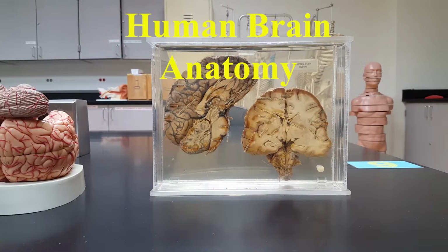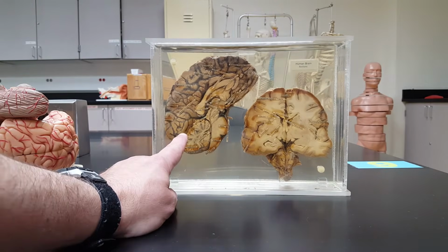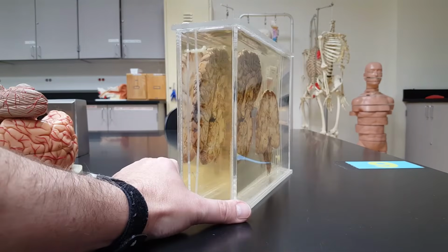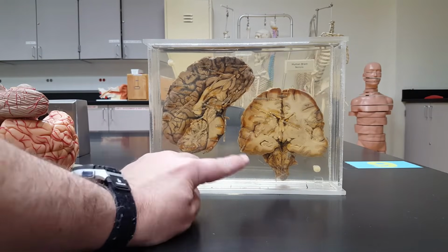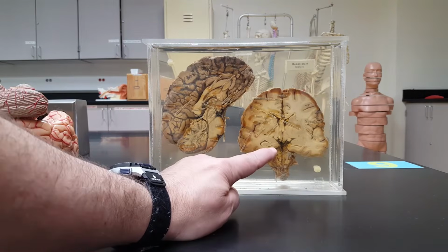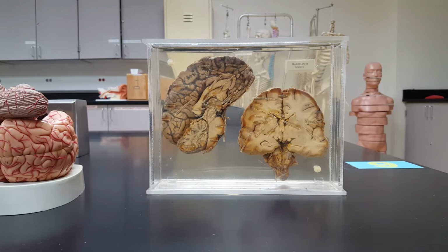Okay, now let's get started on the anatomy of the human brain. What you see before you right now, actual human brains in a plexiglass case filled with preservative. I like to call these my brains au juice. Brains in juice. Now, I use this to demonstrate some of the things that show up first.